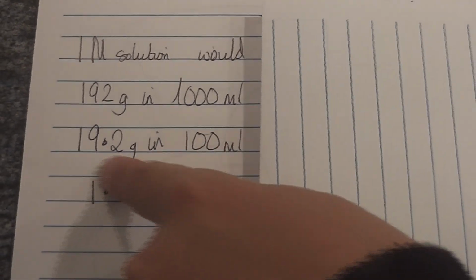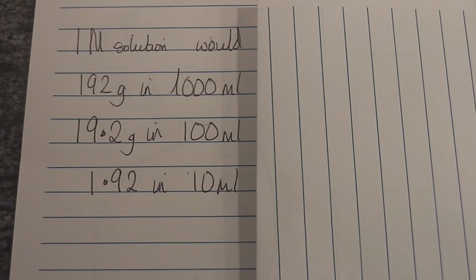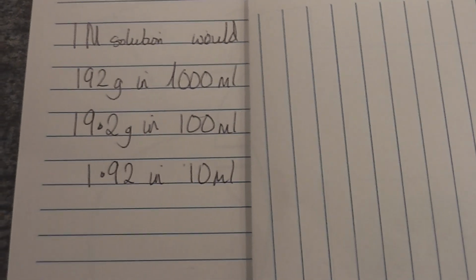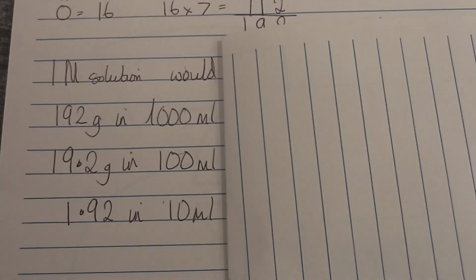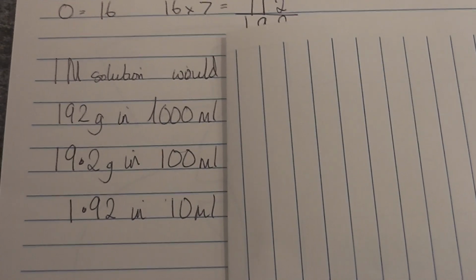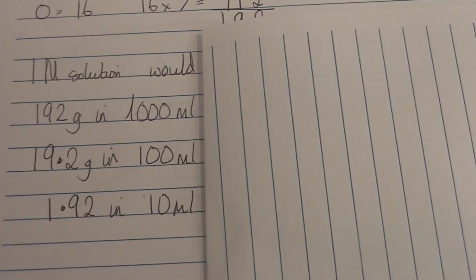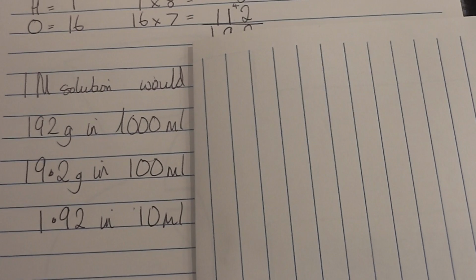But surely we want 100 millilitres then, because that's the most rounded number. Yeah, the problem is I've been using that citric acid for baking and for doing other practicals before. So we might not have 19 grams of it. Yeah, we have actually done a serial dilution of citric acid before, but you were very little when we did it, so you might not remember. No. And also we didn't video it to put onto YouTube.